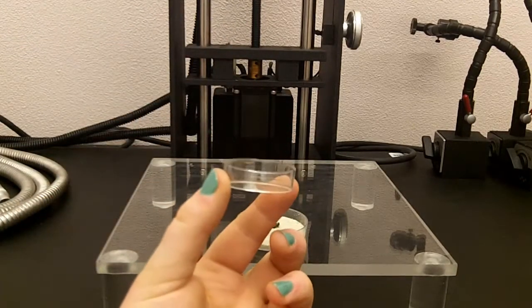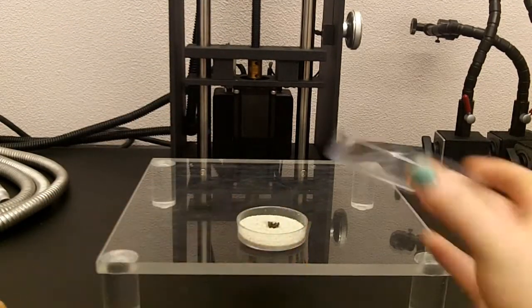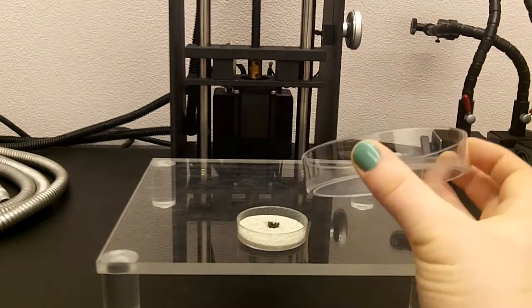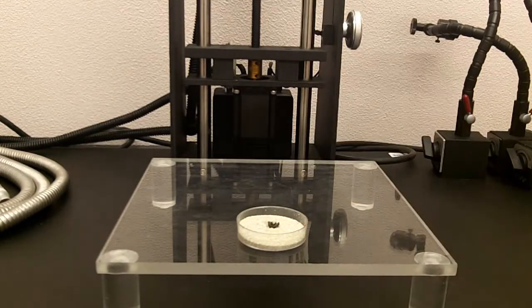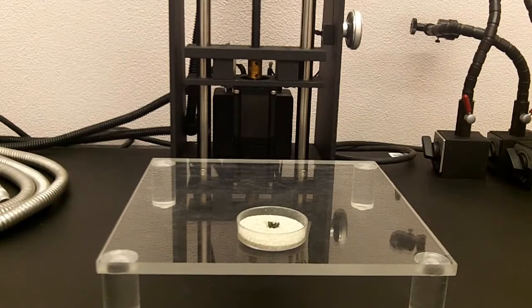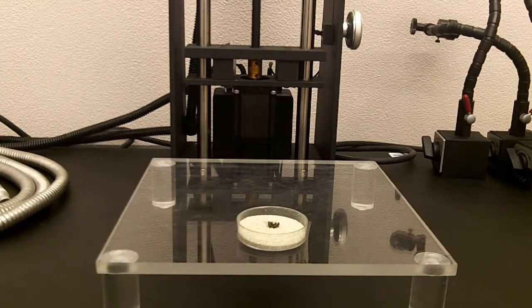This might be a little too small, and this would be pretty big, which would just take more of your time. So now that I have the specimen situated in ethanol, you can do this either way.